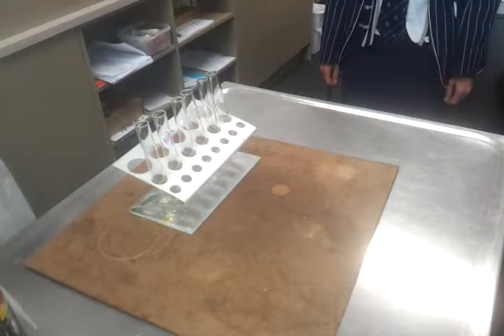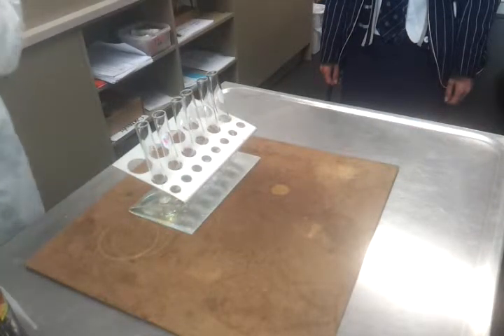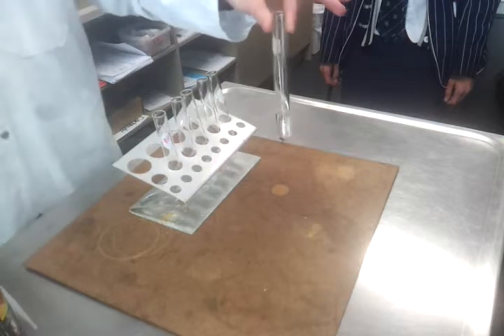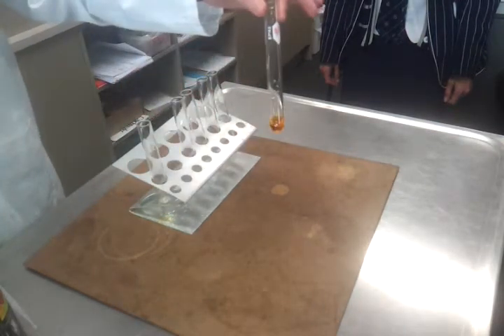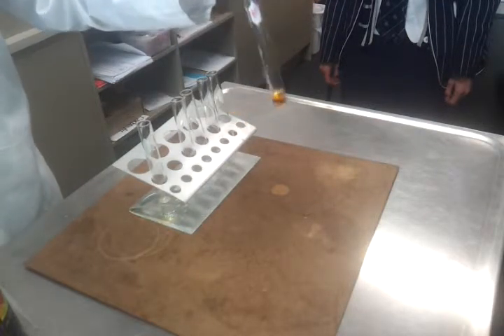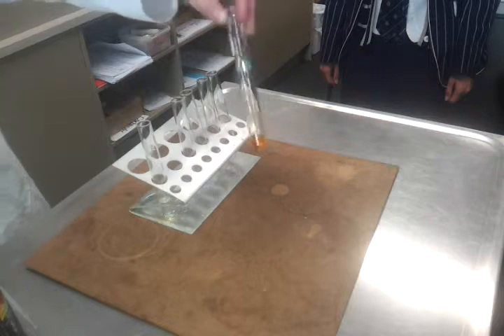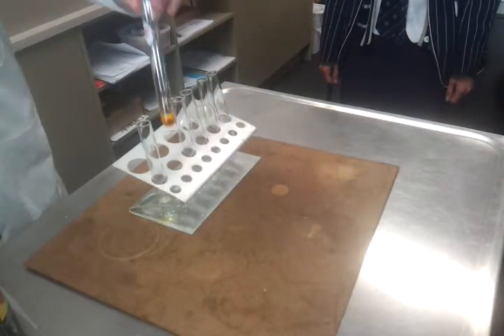So what I've got here is cyclohexane, which is C6H12. It's cyclo, that's why it's CnH2n, not 2n plus 2. In here I've just got tap water. I probably should have used distilled water, but tap water will do the job. And in here I've got a chemical called bromine water. All that means is, as the name suggests, it's bromine dissolved in water. Bromine doesn't dissolve very well because it's non-polar, so it's actually been made with a bit of, I believe, bromate, BrO3 negative, so that it will dissolve.